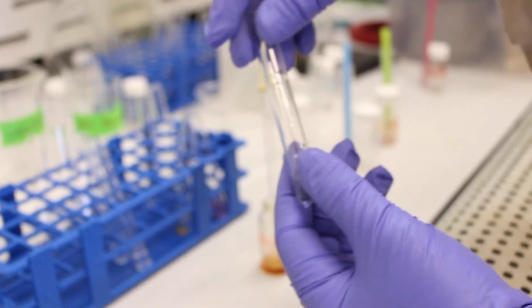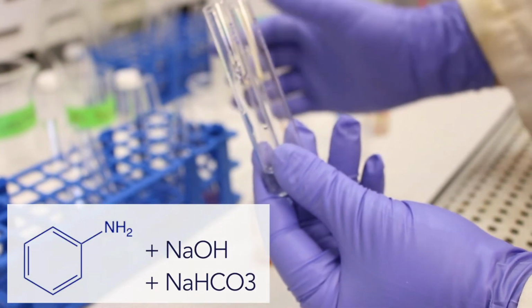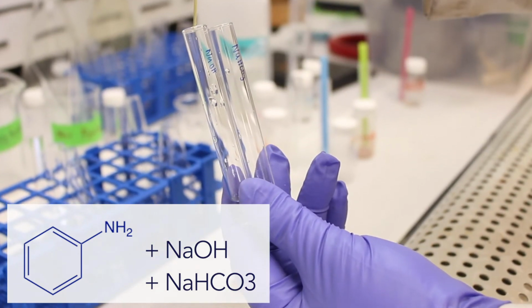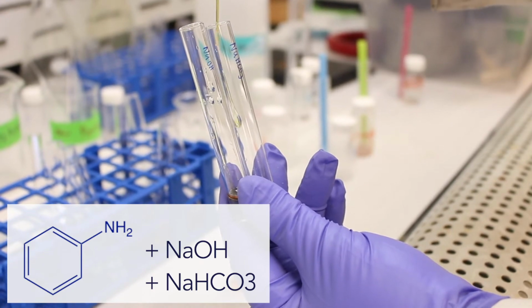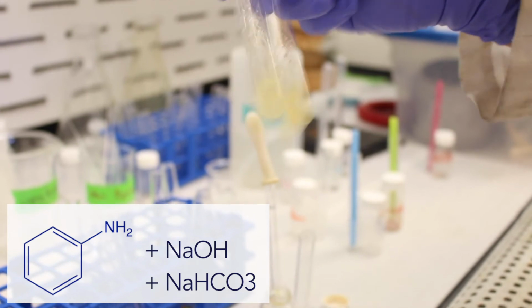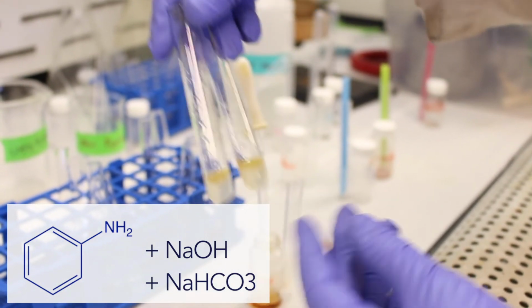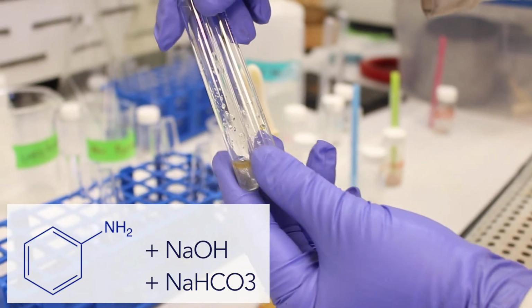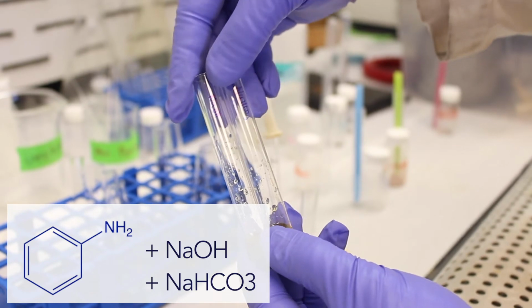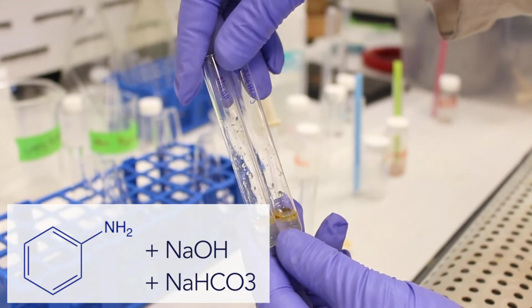If we try now with bases, sodium hydroxide and sodium bicarbonate, bases don't react with other bases. So in this case, we would expect them to both be insoluble. Just like our control, neither of the bases will dissolve aniline. So neither sodium hydroxide nor sodium bicarbonate is capable of ionizing aniline or amines.